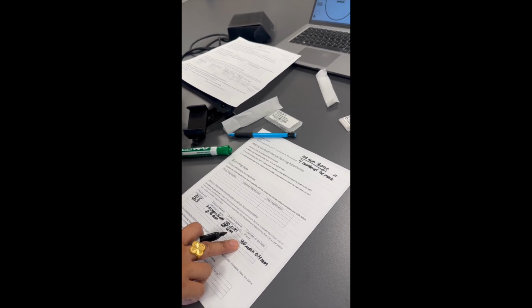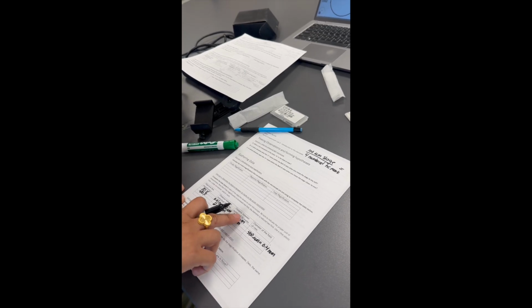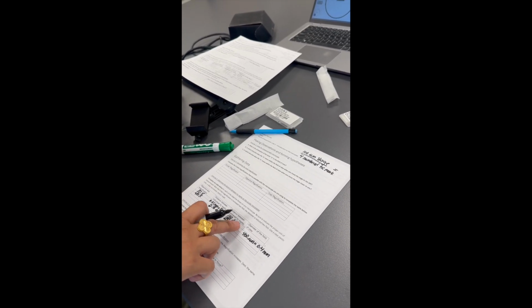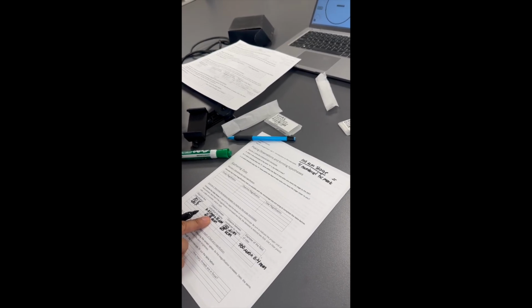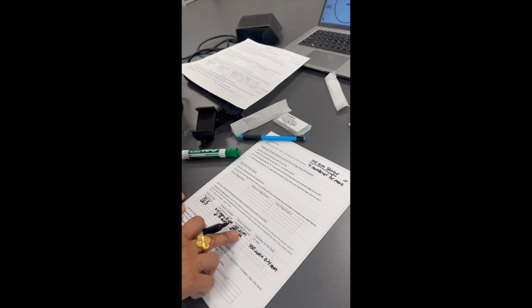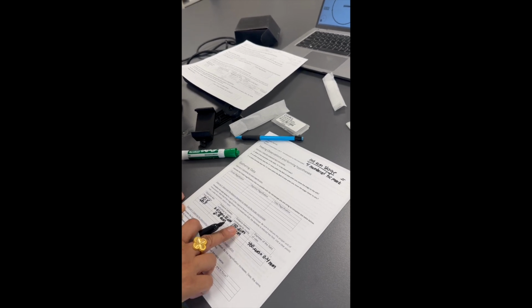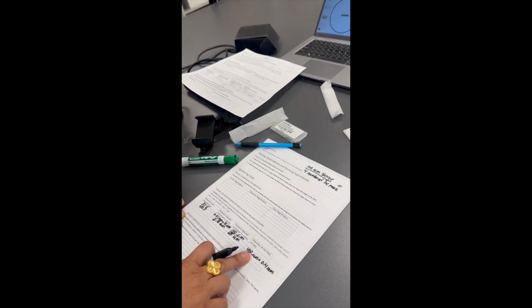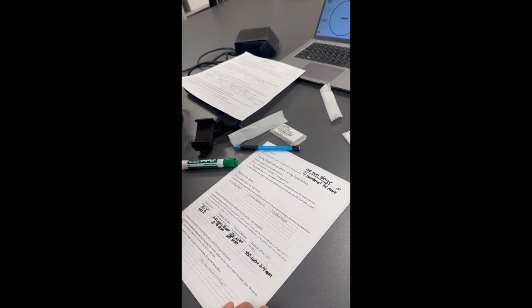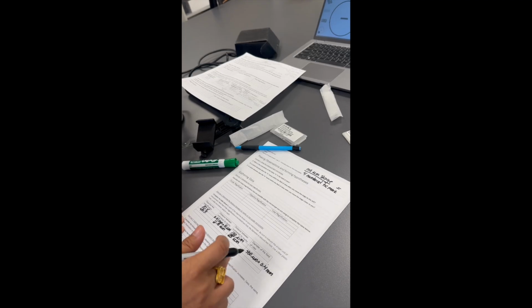25 times 16. So because all of these columns end up being ratios, like the individual tick marks are 1/10 of the numbered tick marks. The numbered tick marks end up being 1/16 of the entire length of the field of view.